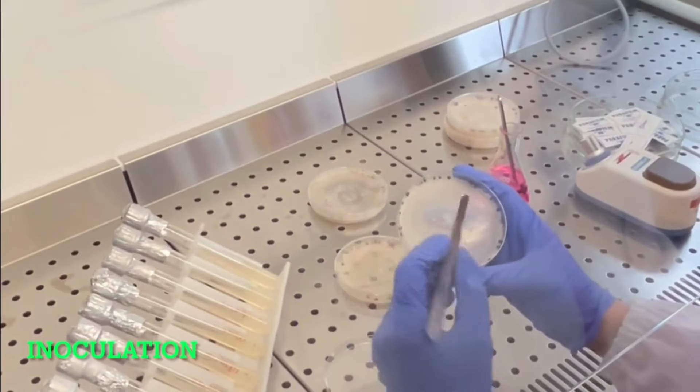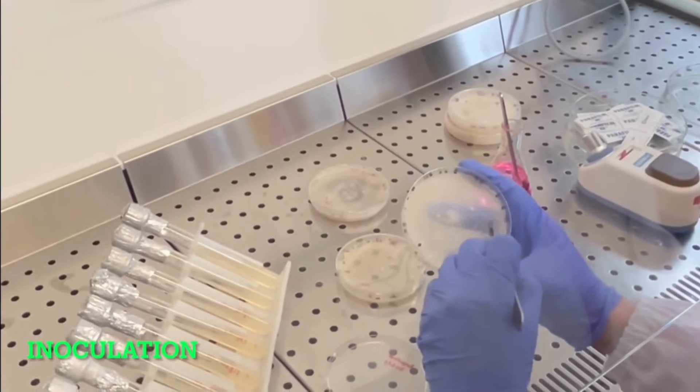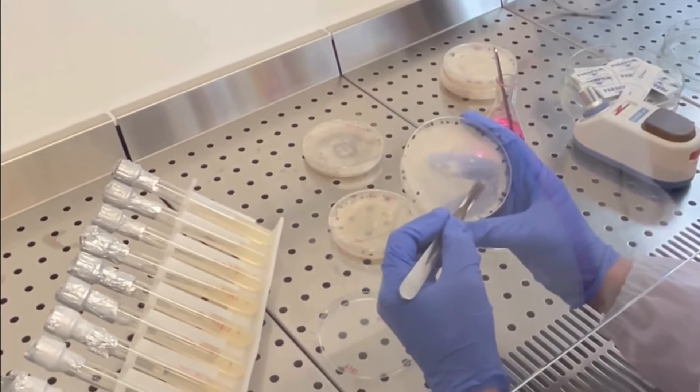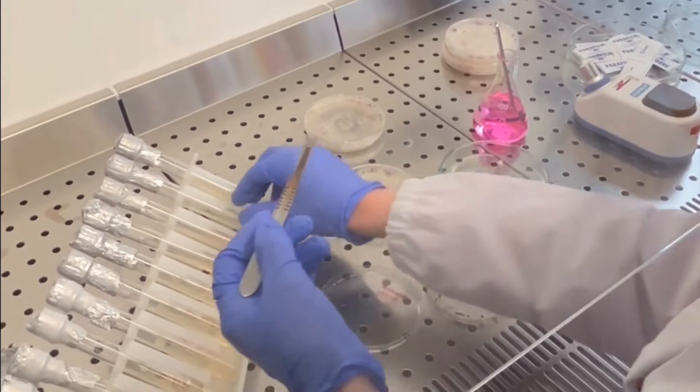Inoculate the PDA tubes with Sclerotinia for long-term conservation. These isolates will be used for molecular investigation and involved in specific trials.